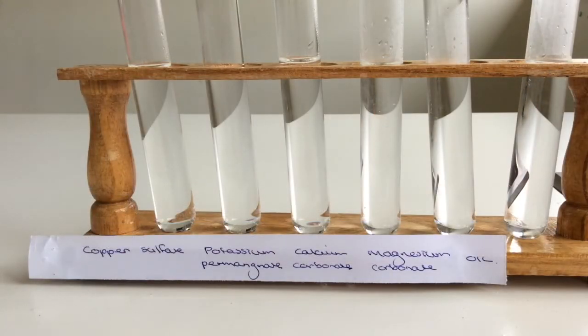Part 2 of the soluble-insoluble experiment is to use a few chemicals that are found in the prep room. Apart from oil, you could use vegetable oil. That's an additional one that I just put in there. You don't have to actually write down any observations on the vegetable oil. I'm also going to show you this time what the powder looks like.